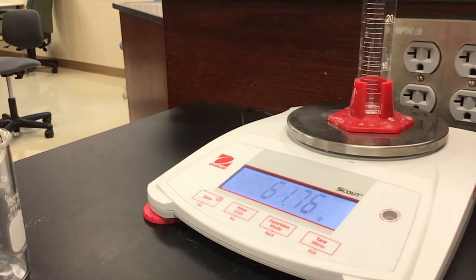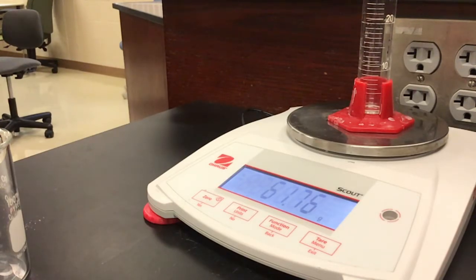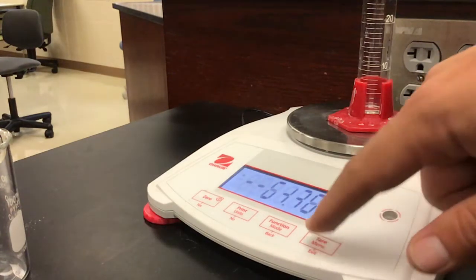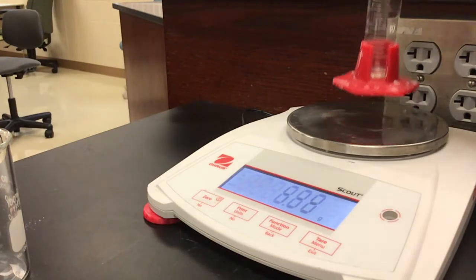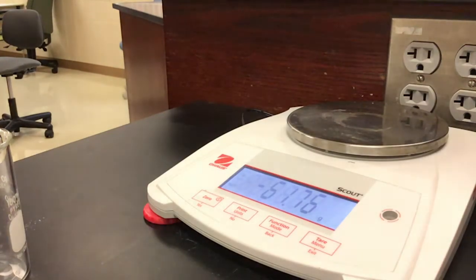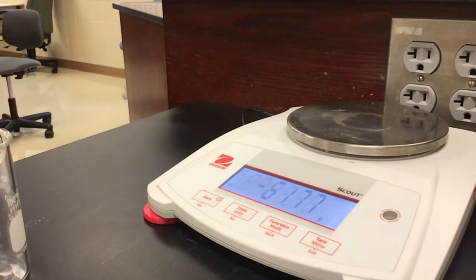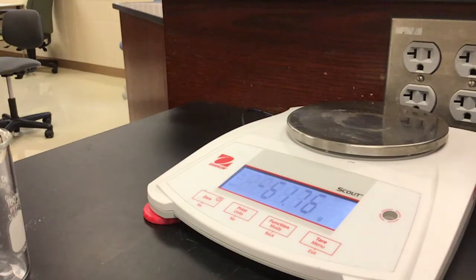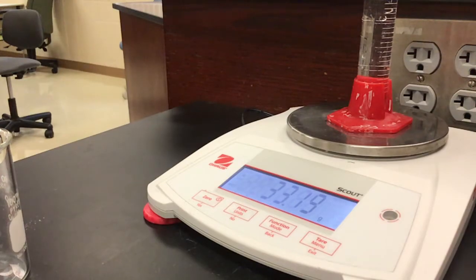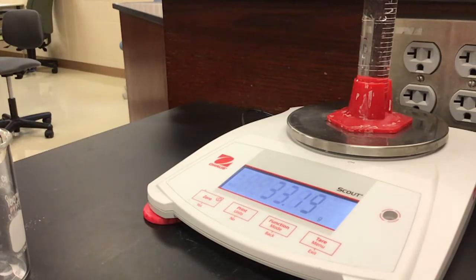We're taking the mass of the 50 milliliter graduated cylinder, recording that mass, and taring the scale. I'm going to hit the tare button — notice that changes it to zero. Now I'm going to add 35 milliliters of water, or thereabouts; the exact amount is not super significant. This is pretty close to 35. So the water is 33.19 grams. Write that down: 33.19 grams of water.